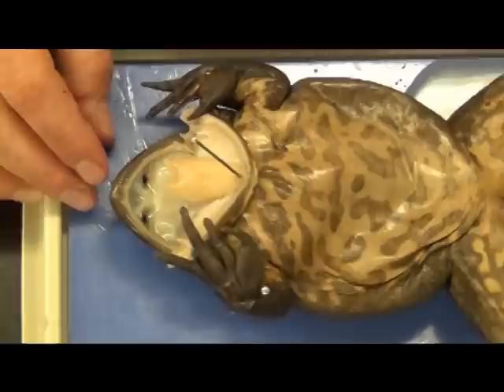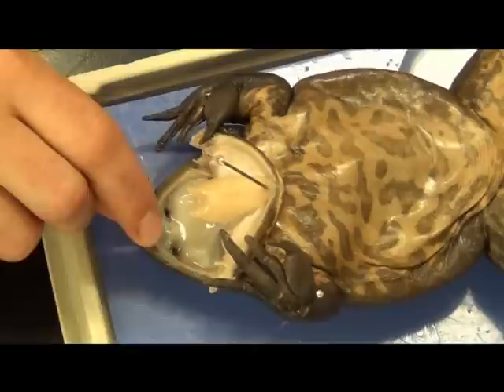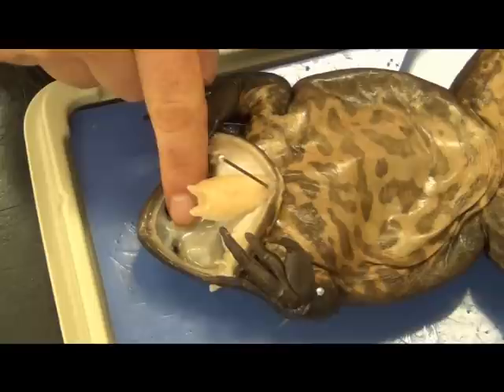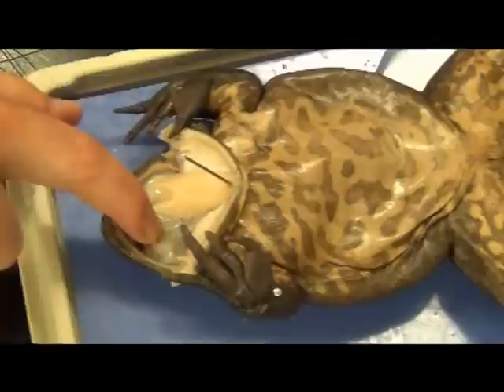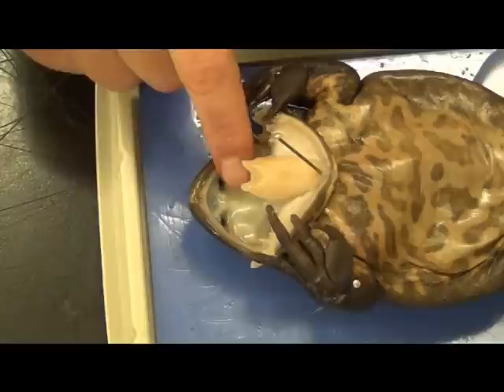There are two sets of teeth. Around the lip on the top, if you push down and inside, you'll feel a very fine serrated edge — these are called maxillary teeth, kind of like the feeling of a butter knife, and they're good at grasping. The other set that most people are very unaware of are called the vomerine teeth. If you look closely you'll find two little nubs on the inside near the internal nares, and if you put your finger inside and try to pull back, you'll notice literally thousands of tiny microscopic barbs — kind of like Velcro — that keep your finger from coming back out.